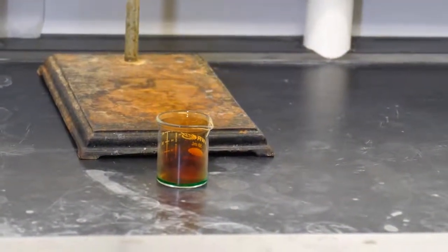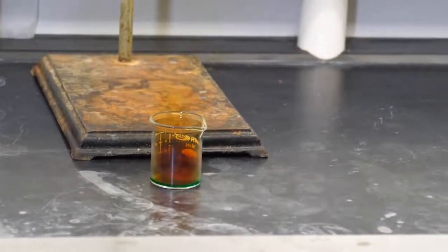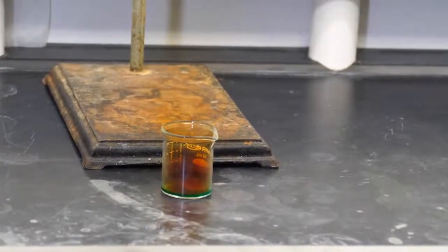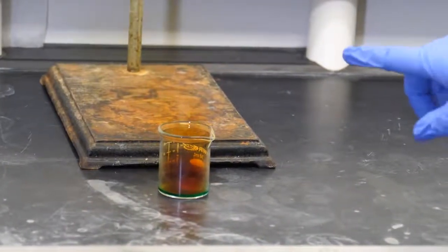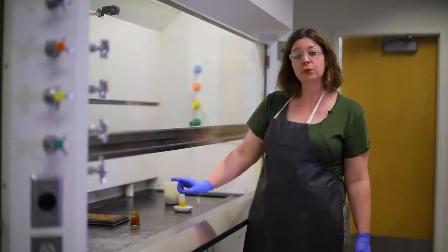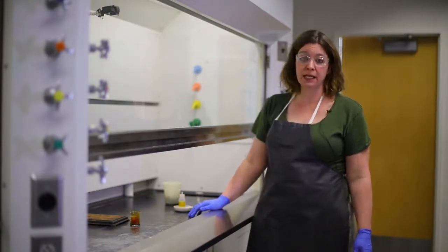The copper is reacting away. It's dissolving in this concentrated acid. And it's dissolving so enthusiastically you can see some bubbles forming. And more importantly, you can see this really nasty gas that's given off. This is NO2, nitrogen dioxide, and this is an extremely toxic gas.